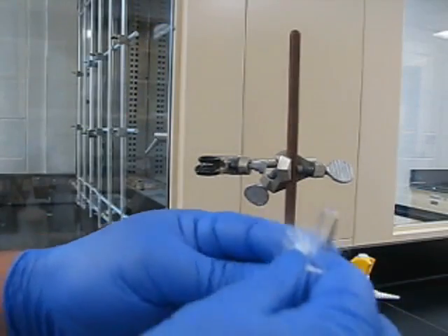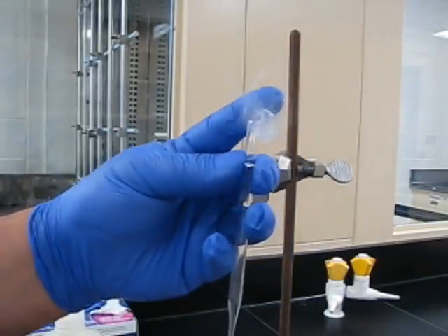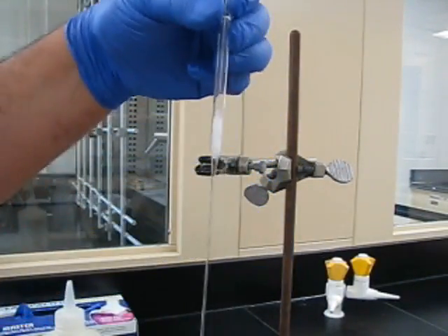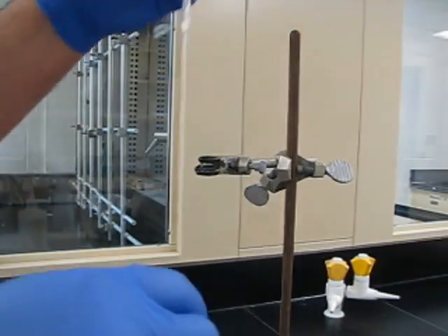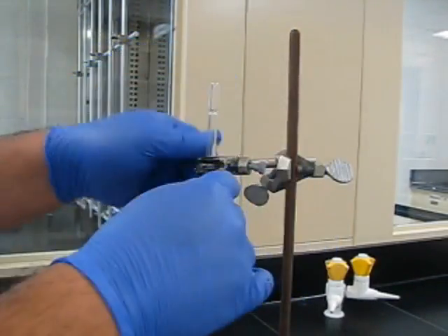You're going to see there's two sets of long pipettes. One has bent on the bottom, the other ones are not. You're going to push some glass wool into the pipette that is bent on the bottom, using one of the ones that are still straight.